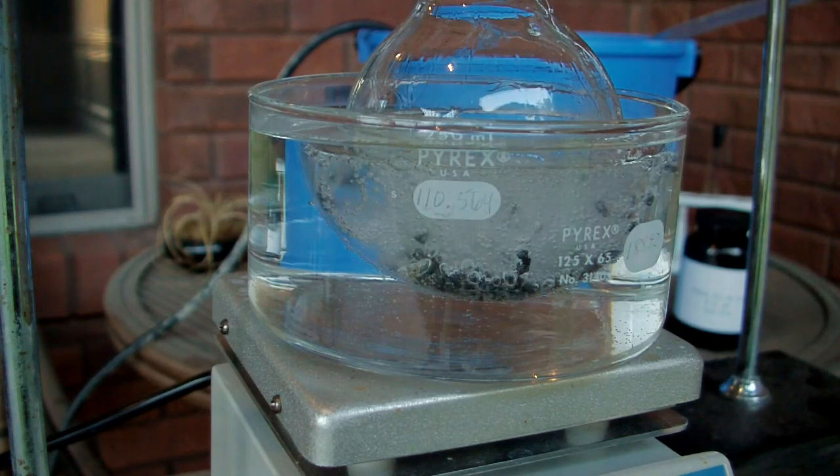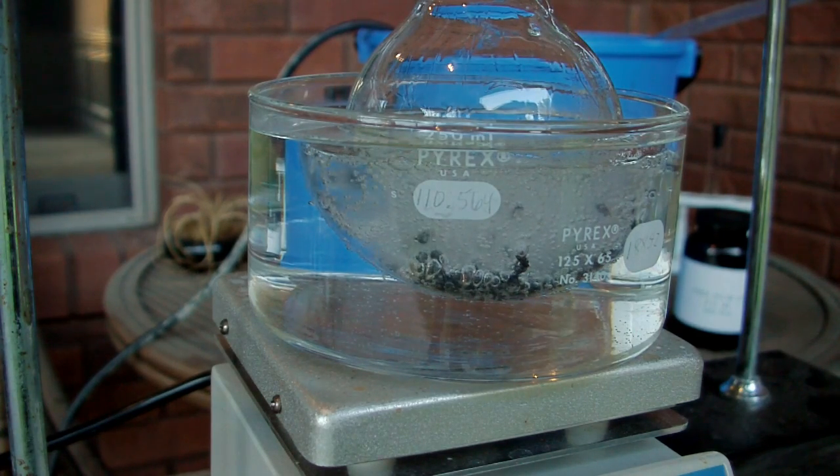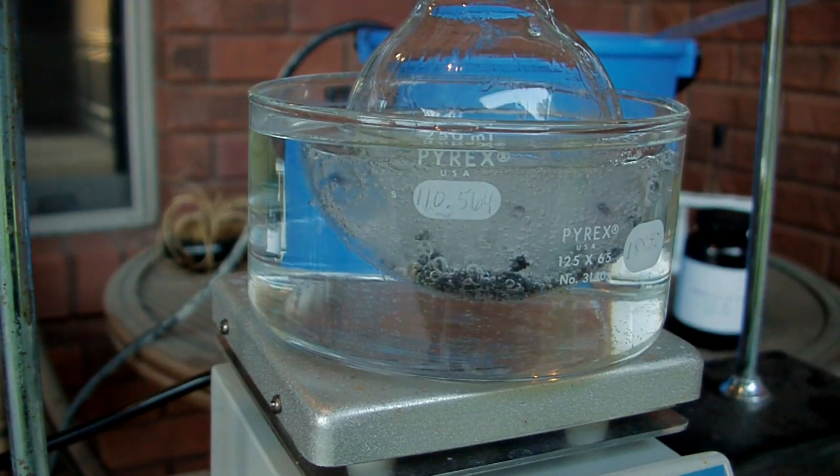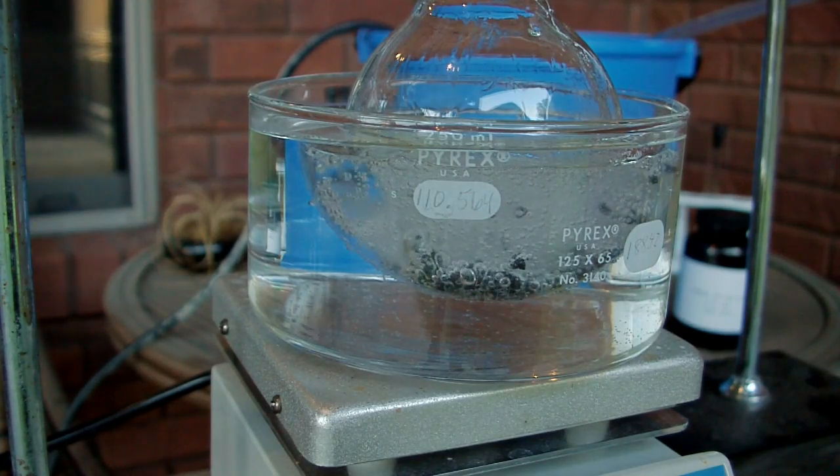Really the main thing for me is to just separate out the solvents from this plastic goop so that it's actually usable for me.